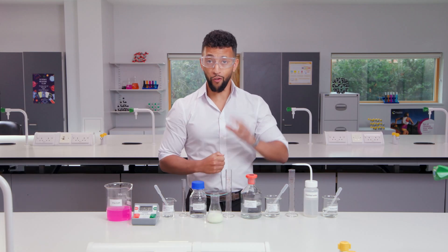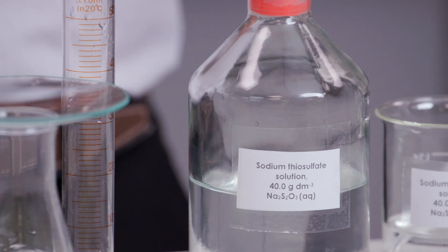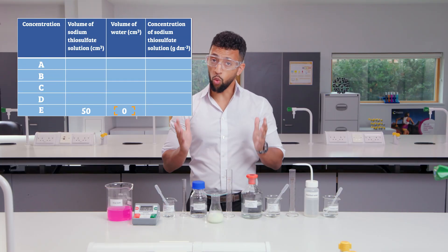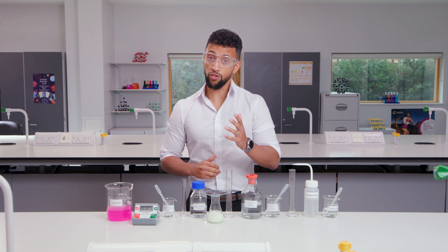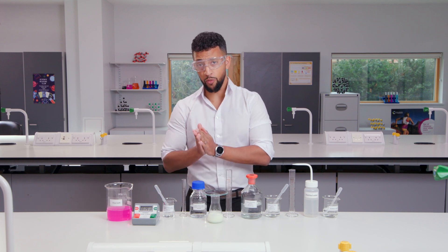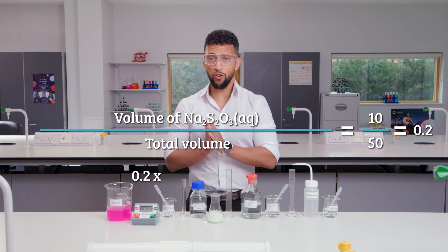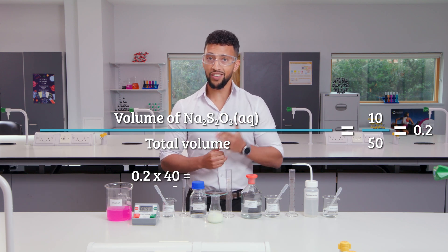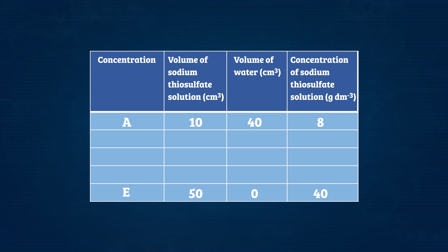Now I've carried out three repeats of five different sodium thiosulfate concentrations. We need to calculate the concentrations and the average times. To work out the concentrations of A to E, we need to know what we started with — the sodium thiosulfate stock bottle says 40 grams per decimeter cubed. As I added no water to E, the concentration of sodium thiosulfate in E was 40 grams per decimeter cubed. For experiment A, there was 10 centimeters cubed of sodium thiosulfate in a total volume of 50 centimeters cubed. 10 divided by 50 equals 0.2; we then multiply 0.2 by 40 grams per decimeter cubed to get 8 grams per decimeter cubed as our concentration for A. You can work out the concentration of sodium thiosulfate in B, C, and D in the same way.